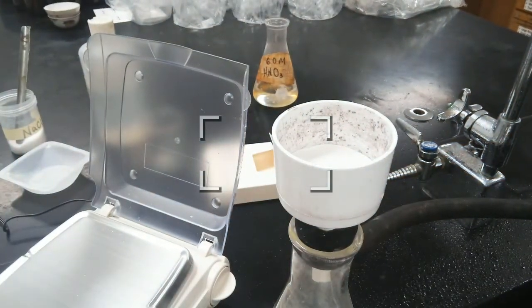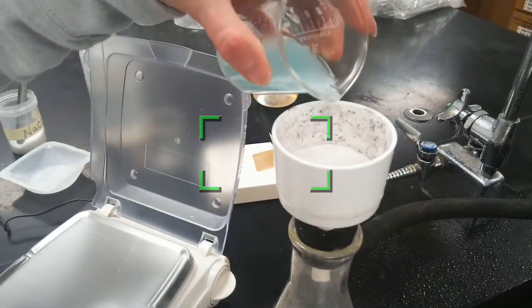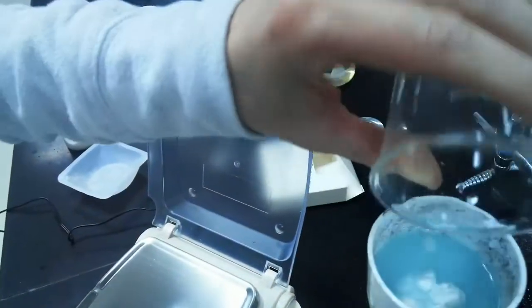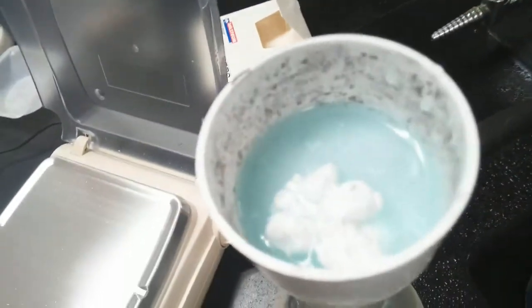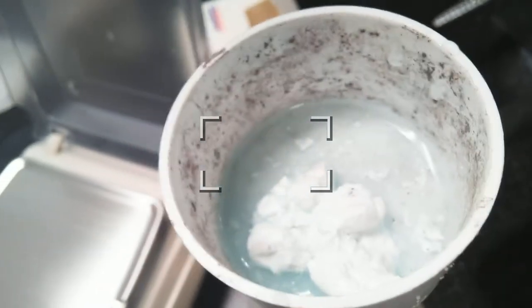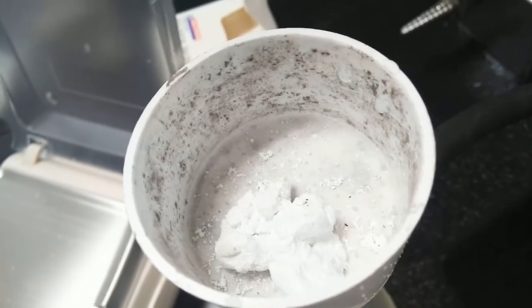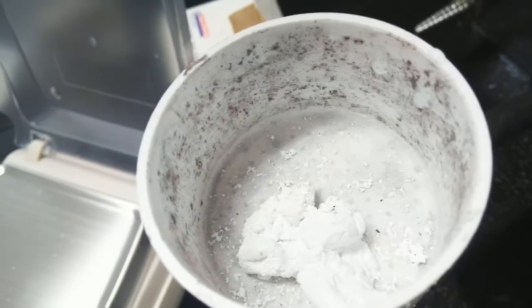Yes. And so all we got to do now is take our solution, swirl it around a little bit, and watch how quickly it filters. It's sucking the water, or I should say the solution, through in seconds. How crazy is that? No more waiting for drips to drop.